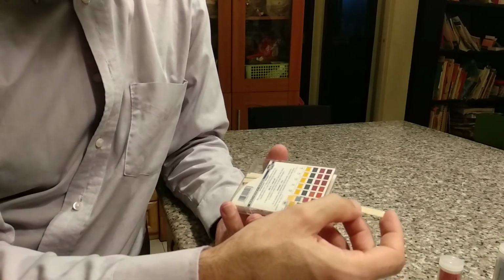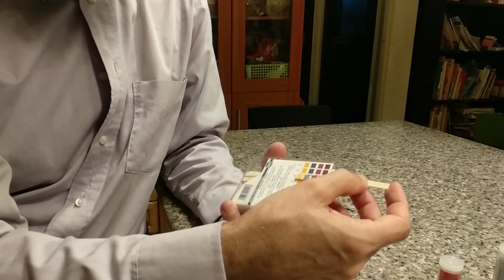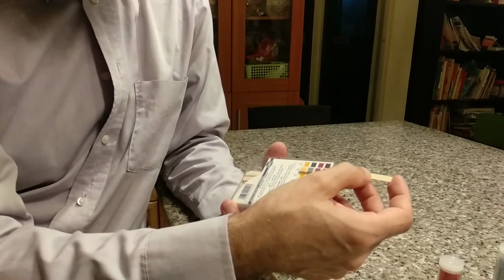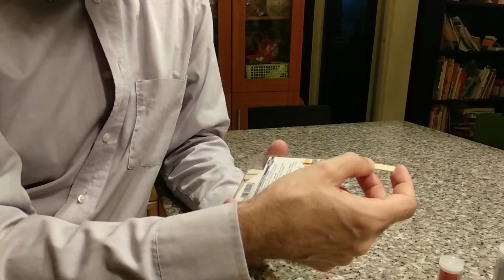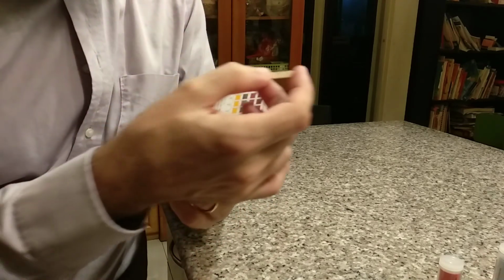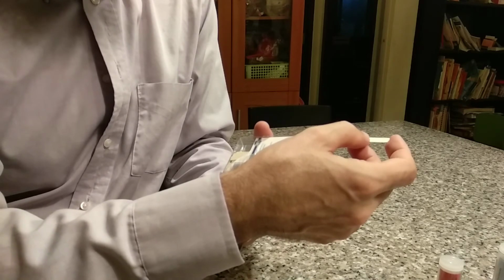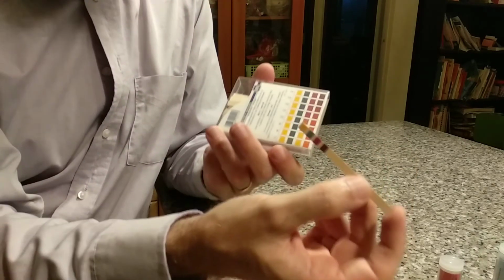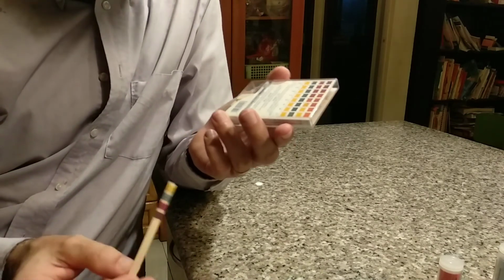So I follow these up and I look at them, and it's darker than this, darker than this, darker than this. They're starting to get close. So this one looks like it's right at that 14. So this one is all the way at the end of the scale. So 13 to 14 is this sodium hydroxide solution that I have.